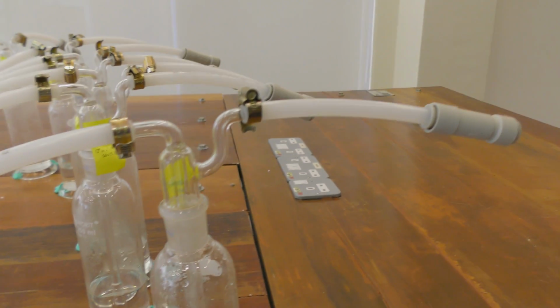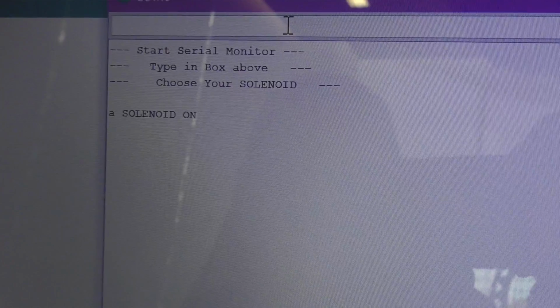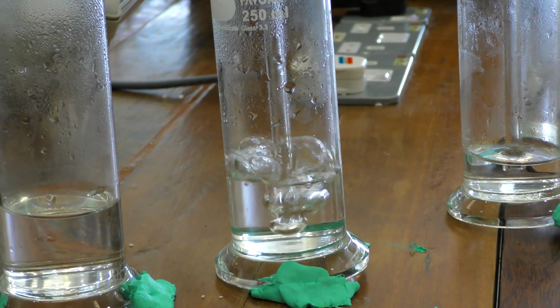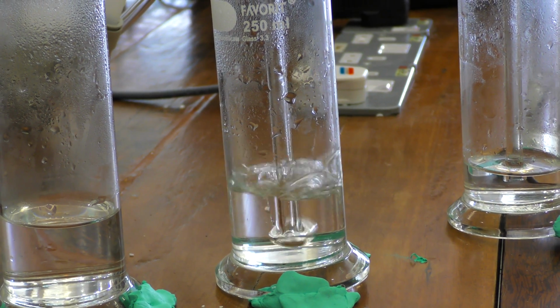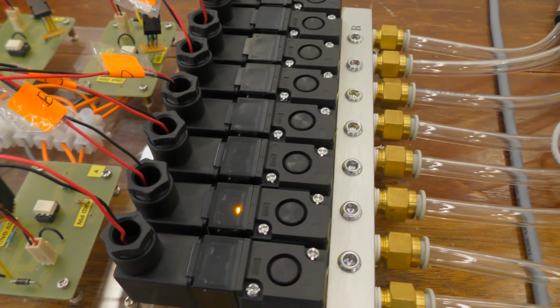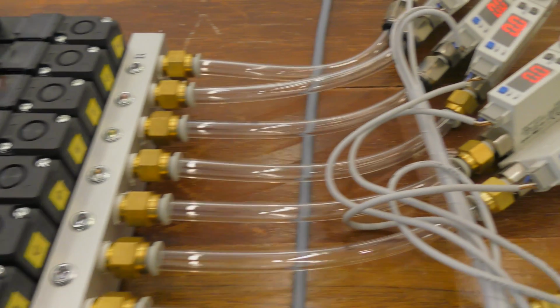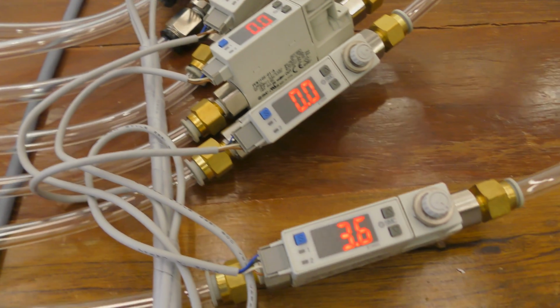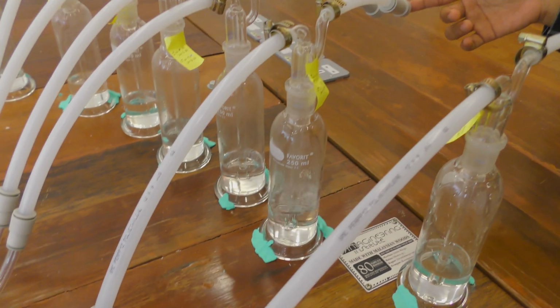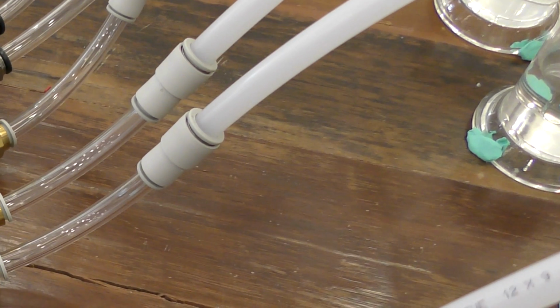If we change to the character B, valve A will switch off and valve B will switch on, and at this point the flow rate is 3.6 liters per minute, and the user can smell it at the glass tube. This is the process of the olfactometer system.